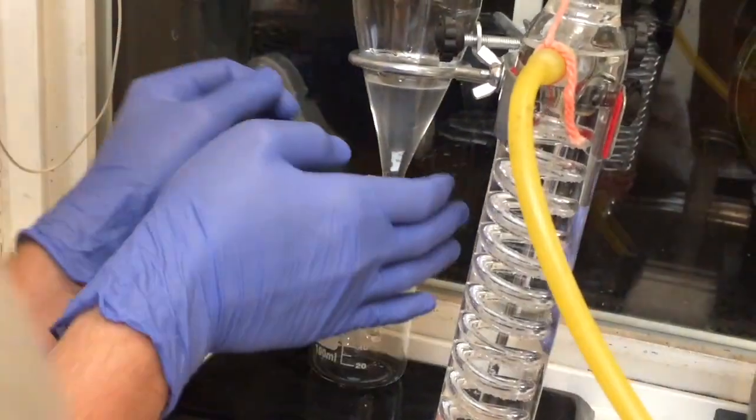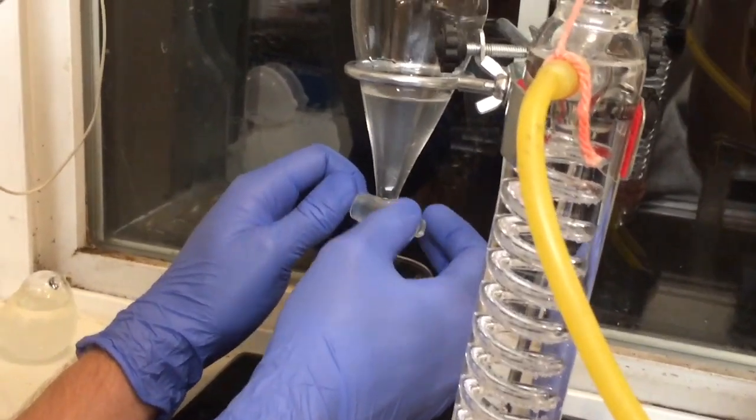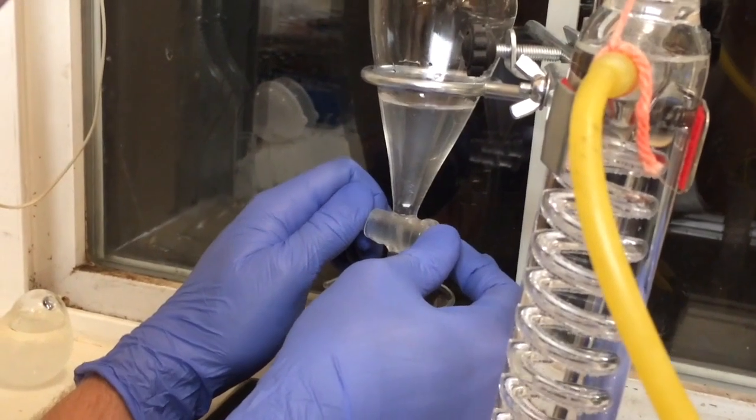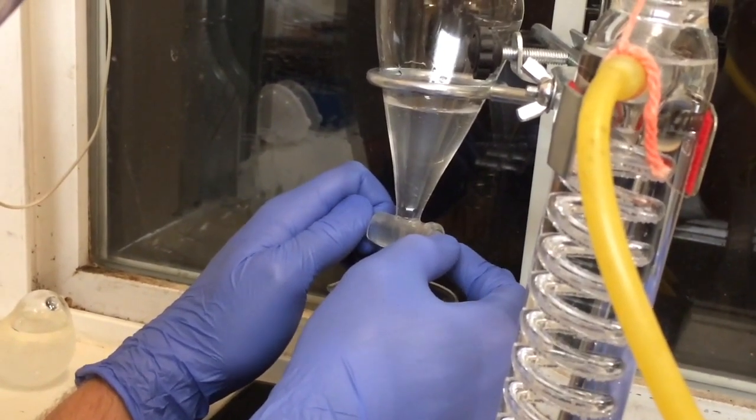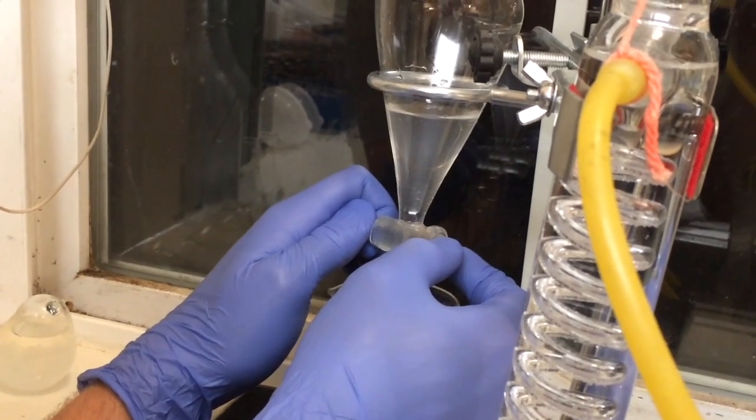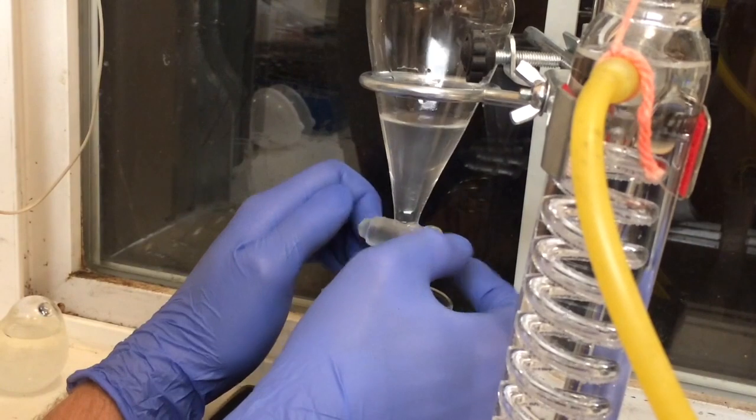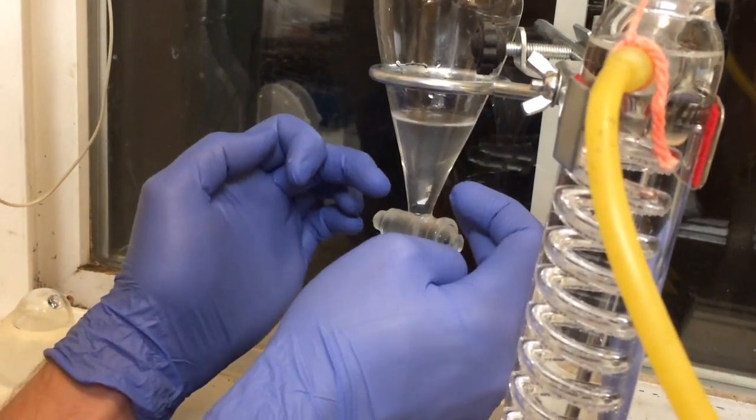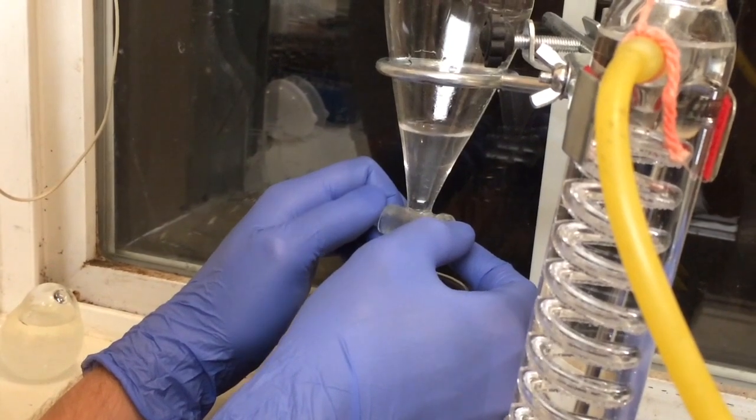It's been about five minutes. We're just going to drain off this water and the hydrosol. And I'm having Cynthia film because I need to use both hands. So as we drain off that water, you'll notice that the oil on top, as it is filtered down into the smaller and smaller space, becomes more and more visible, which is pretty cool.